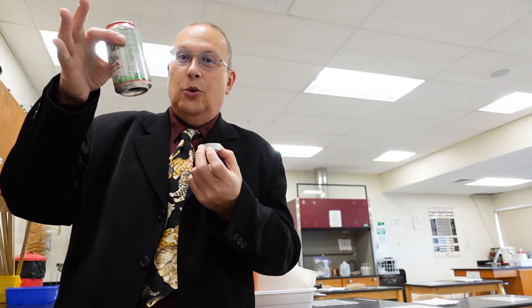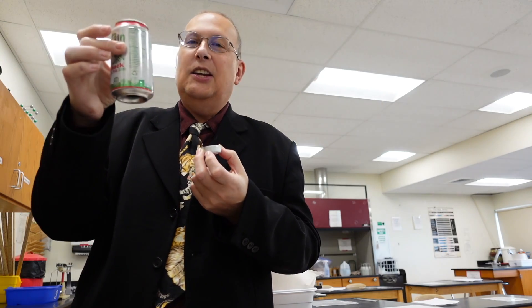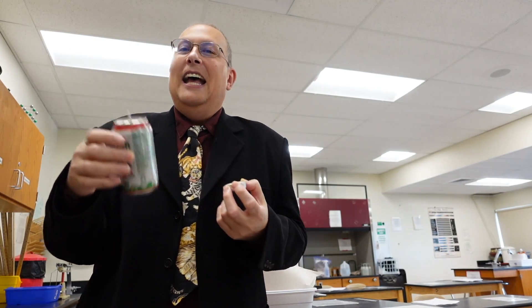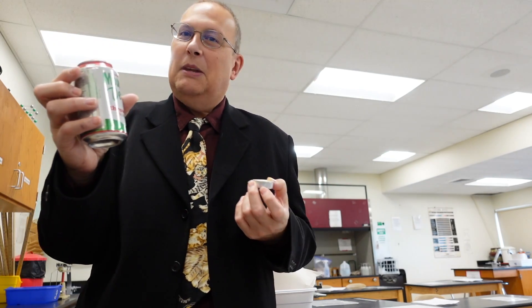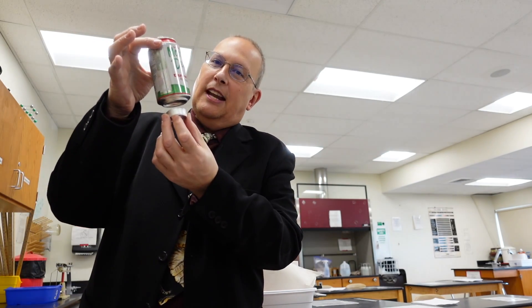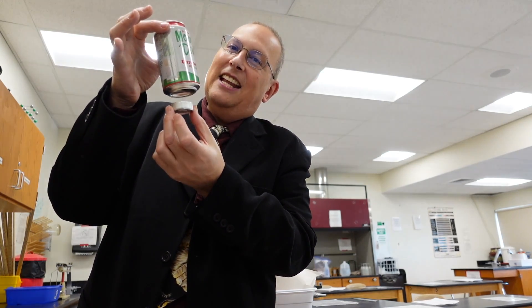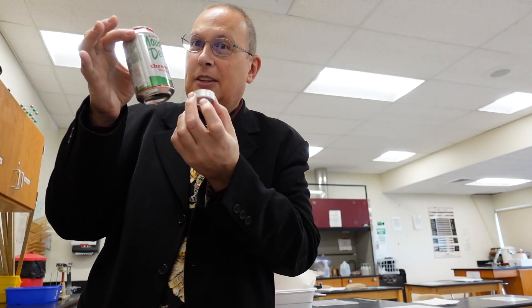What you're going to have to do is transfer the heat from this candle into a calorimeter cup. Yes, I know it looks like a soda can, but we don't have the money for big expensive calorimeters, so we're just going to have to make use with this.